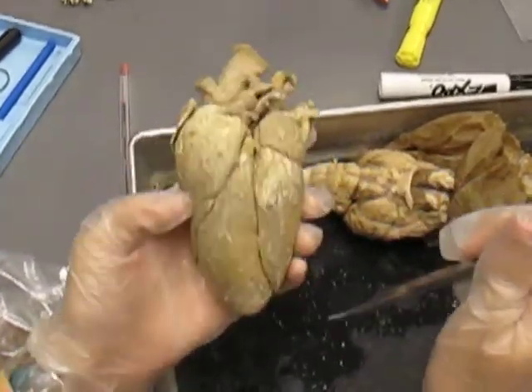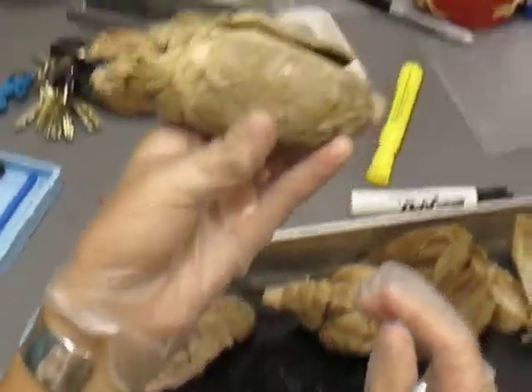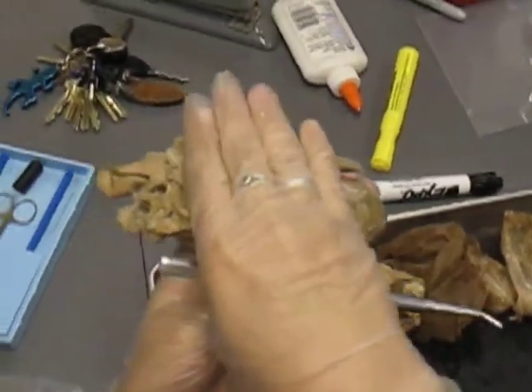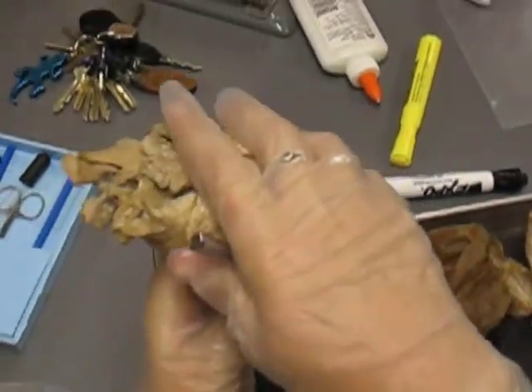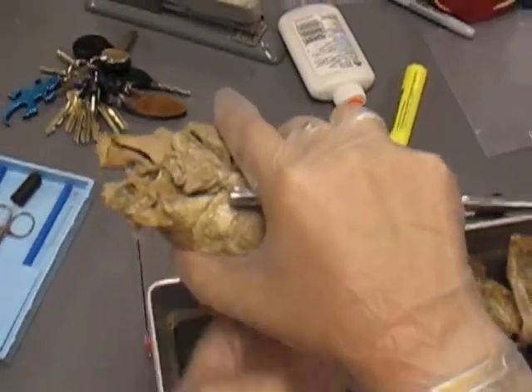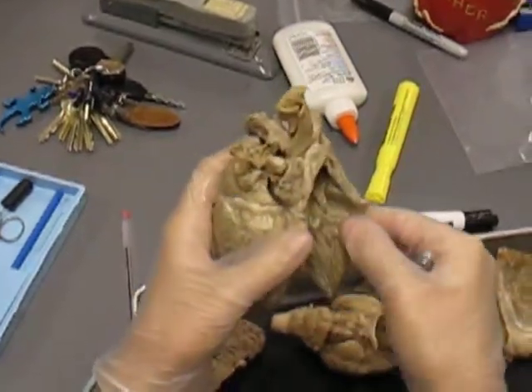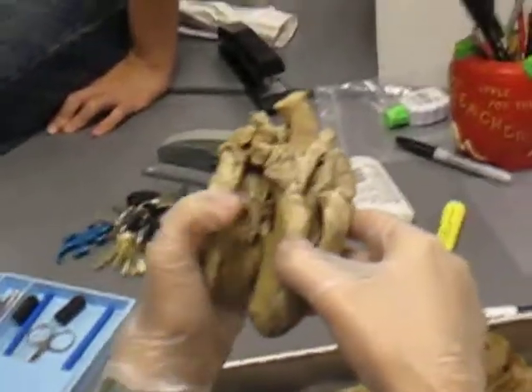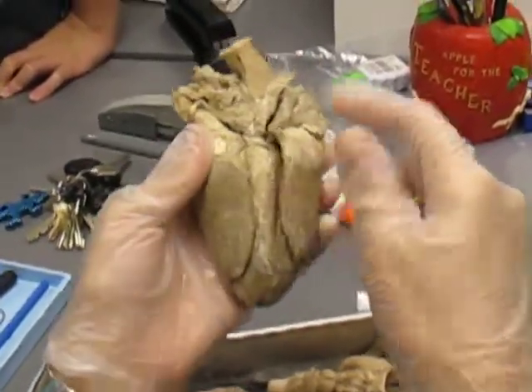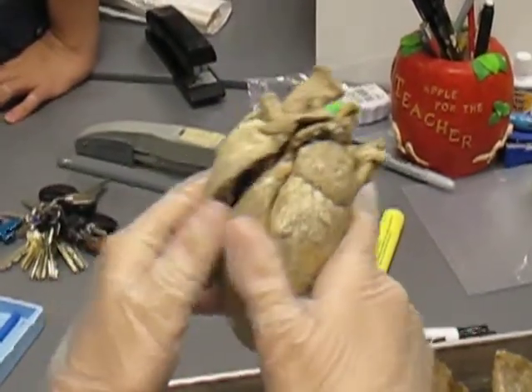Okay, dorsal and ventral sides. Your dorsal side is going to be how it lays in the sheep. The dorsal side of the sheep's up here, so this is the dorsal side of the heart. Ventral side of the sheep down here. This is slightly flatter, this is slightly rounder. The best way though is to look at the two sides. Your right side is going to be thinner, your left side's going to be thicker. So if your right side's actually on your right, then you're looking at a dorsal view. If your right side is on your left, then you're looking at a ventral view.